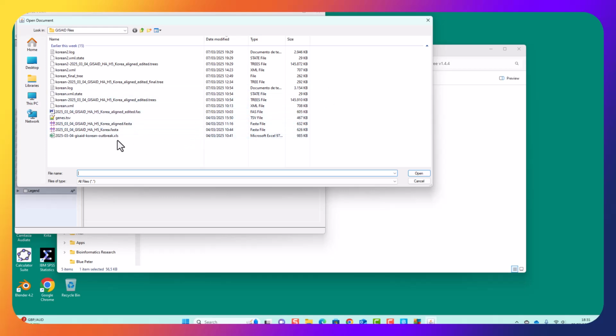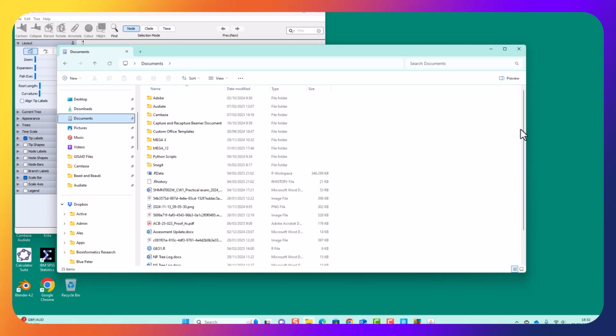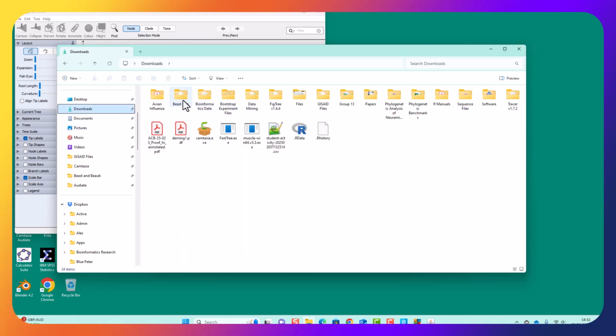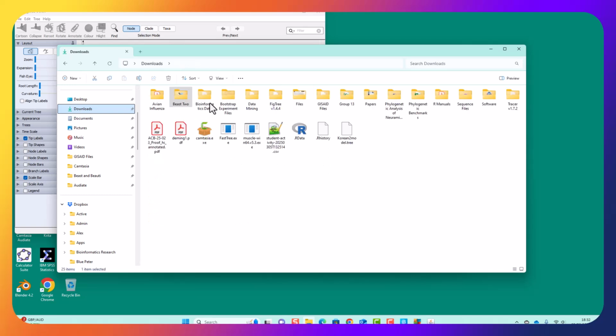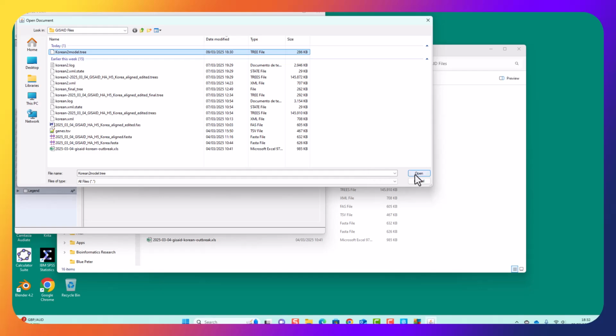tree, which I can't find here. I get this horrible feeling that it's put it in a different place. Where has it put it? Models. Nope. Let's put it in Beast 2. Korean Model 2 tree. Yeah, it has. Fantastic. Let's move it to downloads and move it from downloads into GISAID files. Fantastic. Now I can open it. File, open, Korean 2 model tree, open.